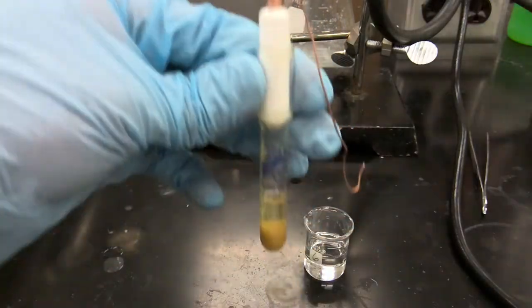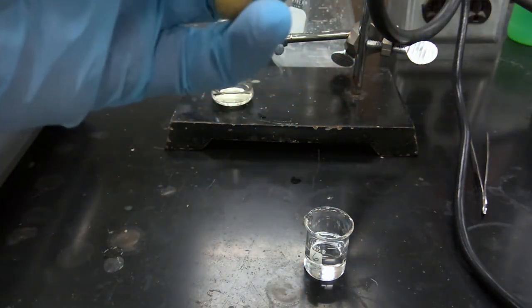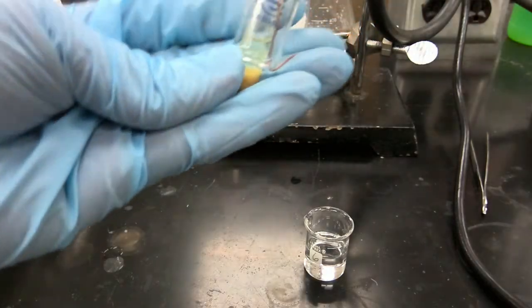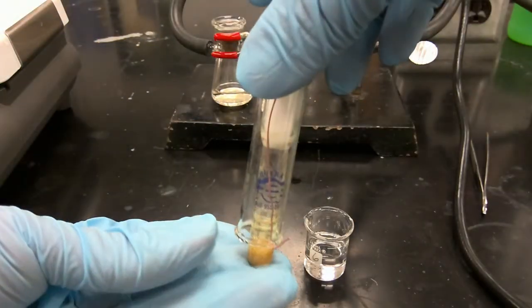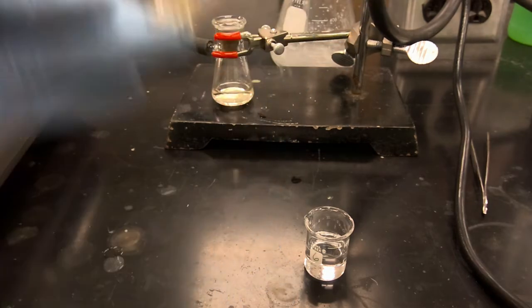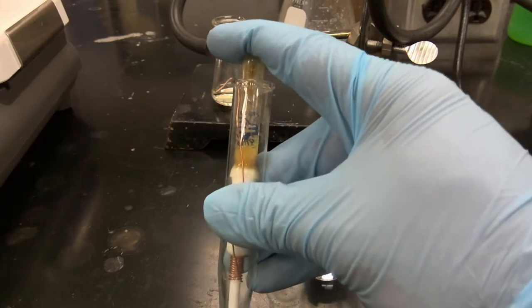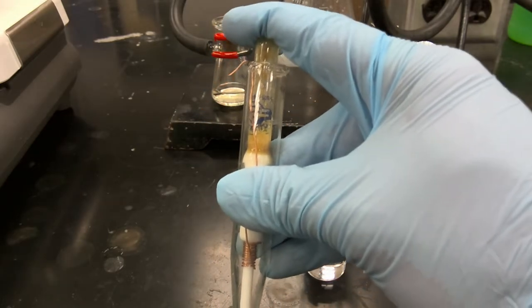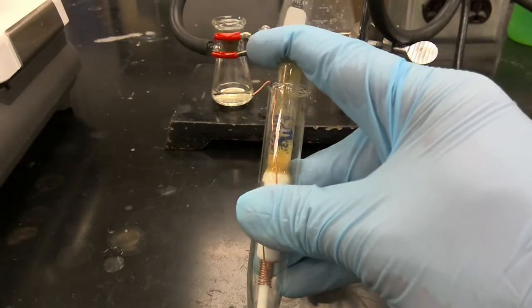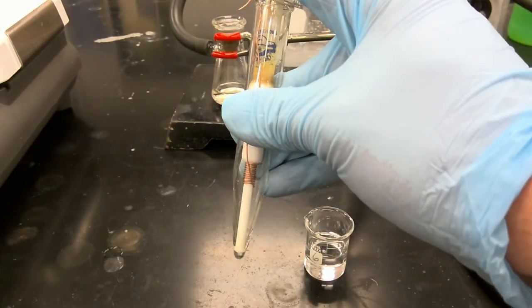Okay, so now we're going to centrifuge this mixture and separate our product from the impurities dissolved in our cyclohexane. So again, just like before, we prepare our Craig tube setup. We hook up our corresponding conical vial that will collect our supernatant liquid, and then we invert. We'll then separate our solid and liquid cyclohexane that has rinsed off some of the impurities in our solid sample via centrifugation.